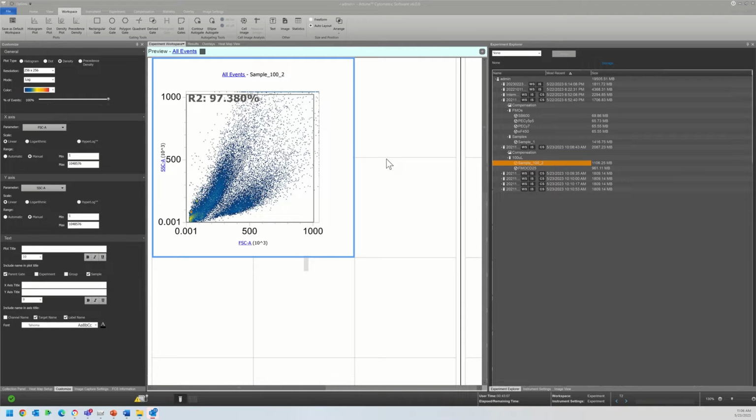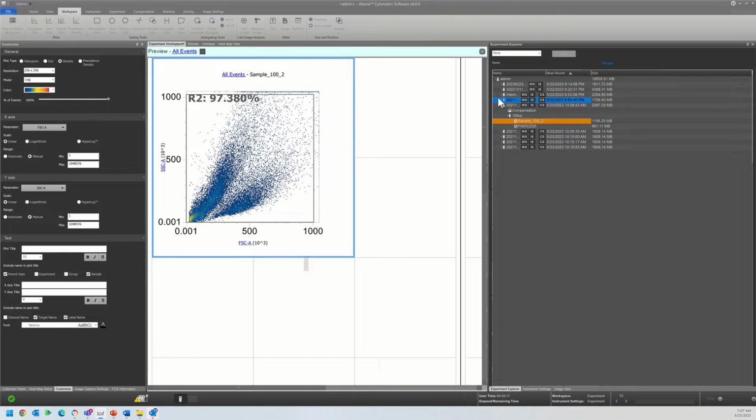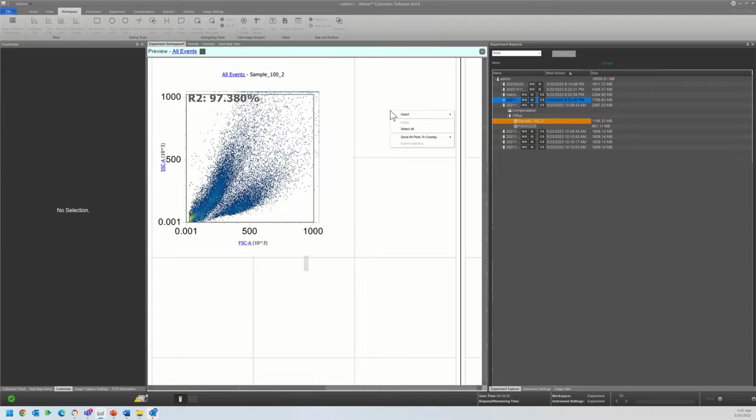All right, so now that we have gone over processing samples, we are going to get started with how to use these extended parameters in begin analysis and just show some examples of ways to potentially use different parameters to improve sample quality or to support your analysis.